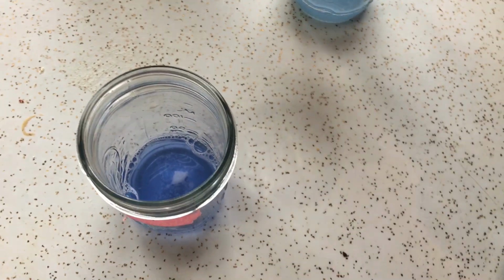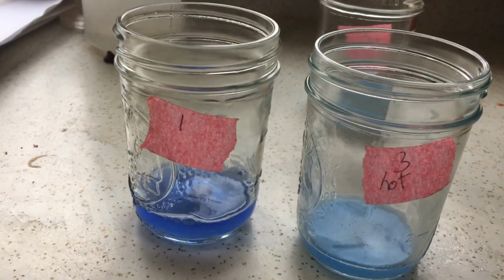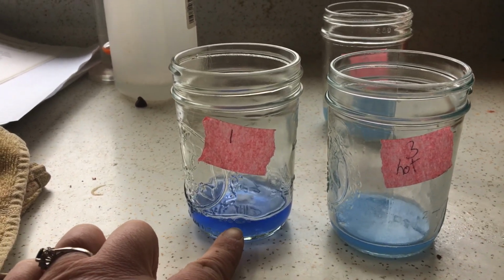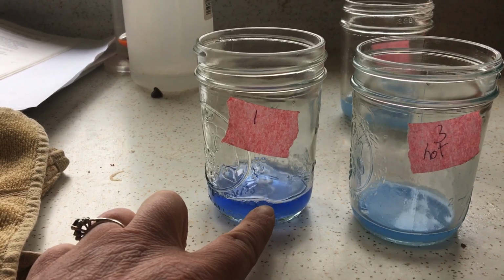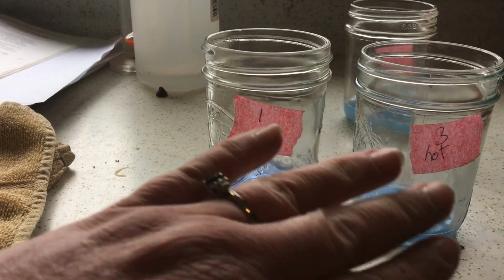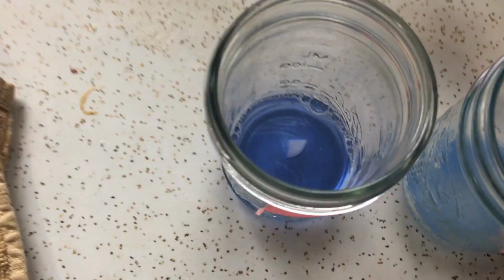Let's take number 2 out of the equation and look at number 3. If you remember, number 3 was hot. We have the same amount of liquid, the same amount of hydrochloric acid, the same amount of toilet bowl cleaner, and we added to each of them a solid 1/4 chunk of antacid. Remember, they look a little different. It's the size, it's the glass, it's whatever. Let's look inside of them and see how much is left.